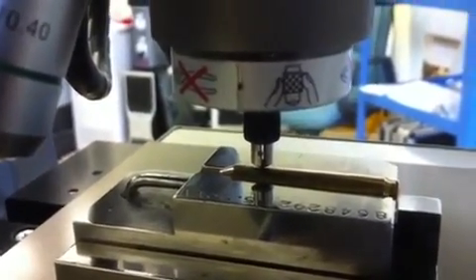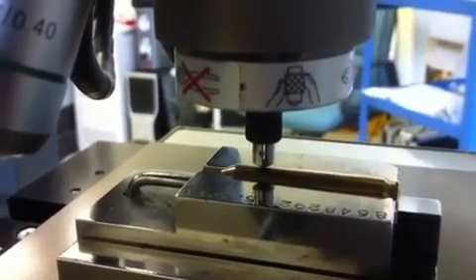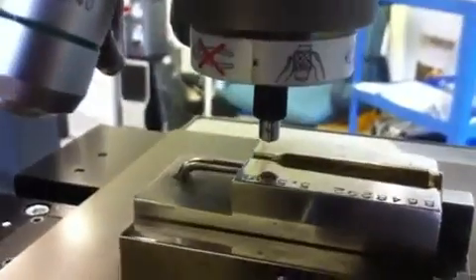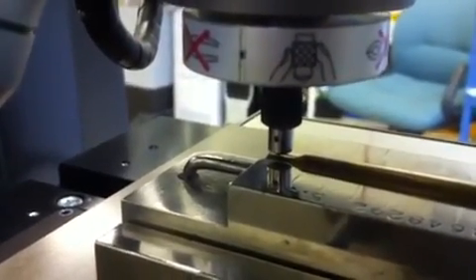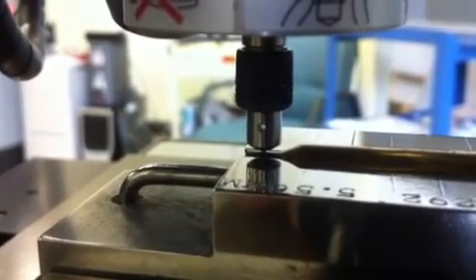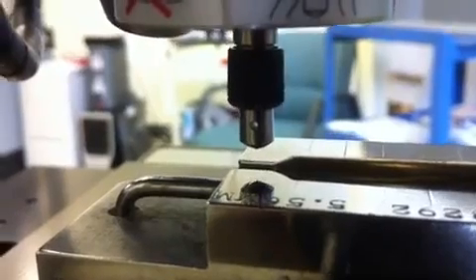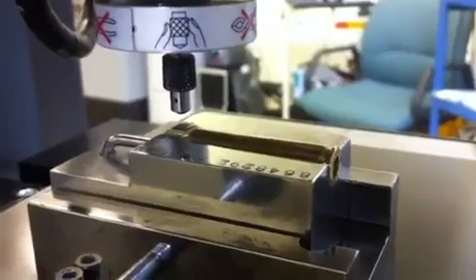And then for the Z-axis recognition portion of this test program, the 2500 will actually recognize the change in height based on my program control. So I just told it that this last indent is at a different height, and you can see that we have that necking portion change in height. I'm trying to get the video for you to show it. Change height and move over to the necking portion of the bullet shell. All 5 of our indentations have been completed.